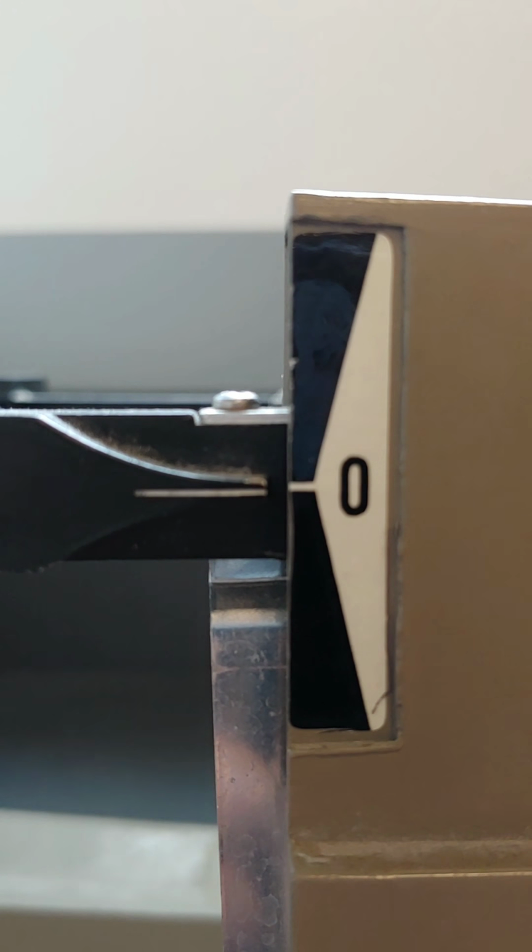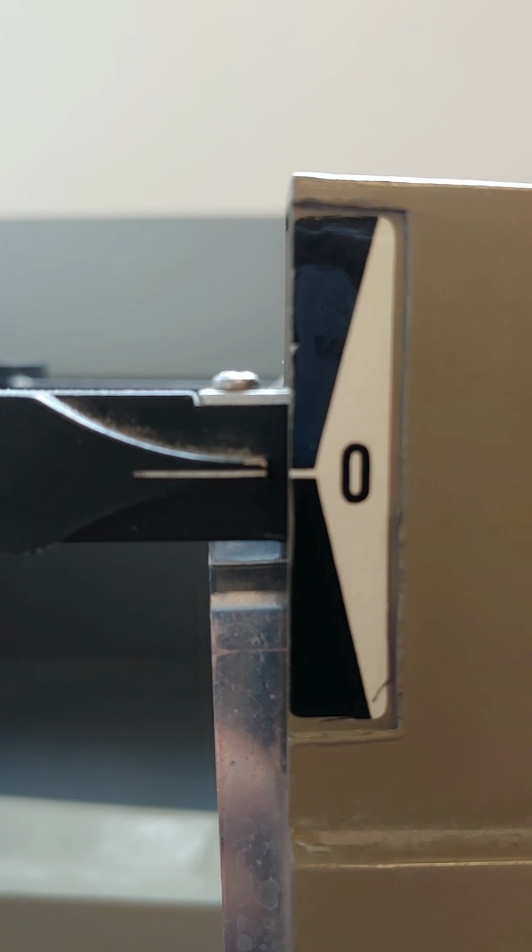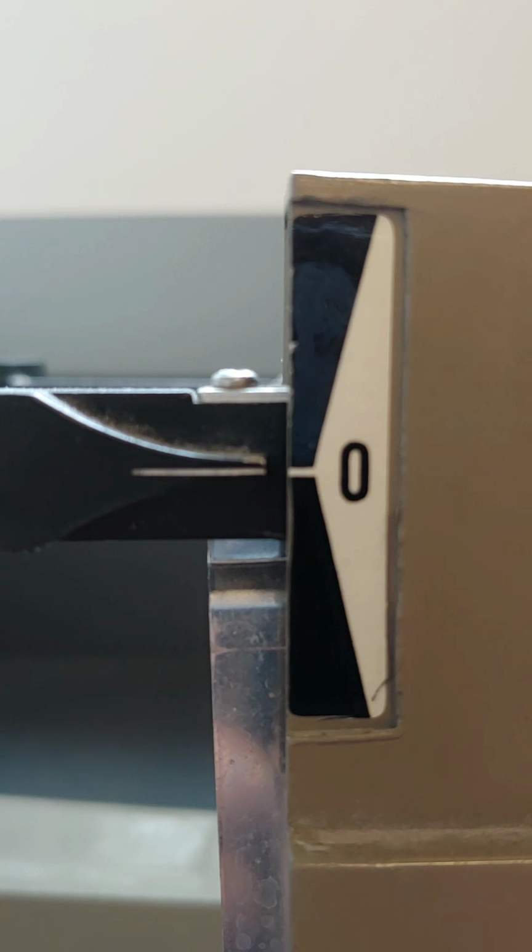All right, so if I move that back, see where we level it out. All right, see now, what are we going to get? If we stop there, that looks pretty close. Close enough for government work, as they would say.